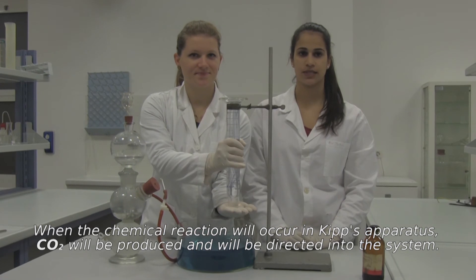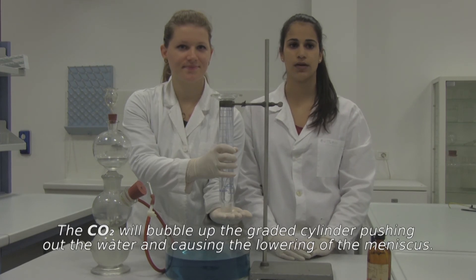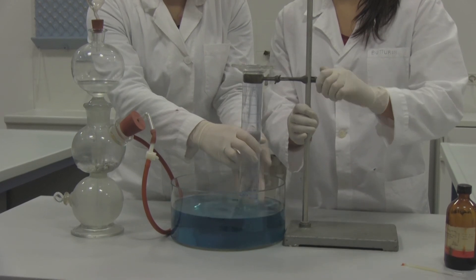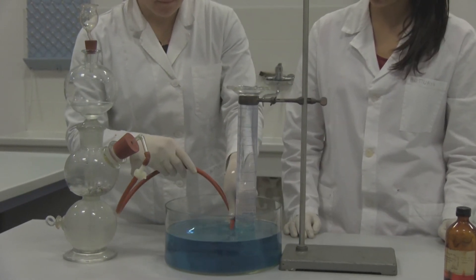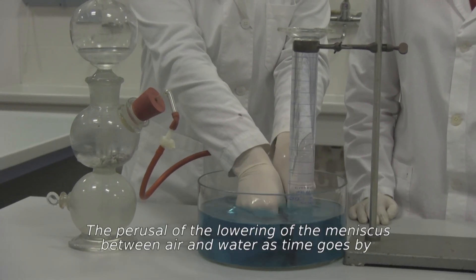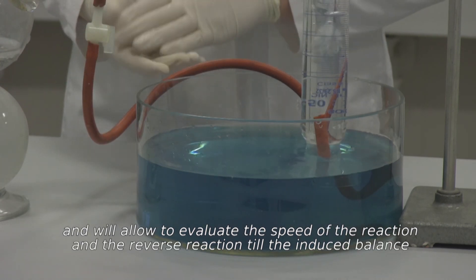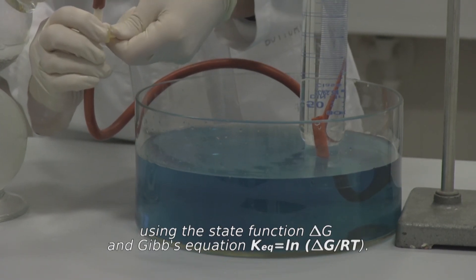When the chemical reaction will occur in Kipp's apparatus, CO₂ will be produced and will be directed into the system. The CO₂ will bubble up the graduated cylinder, pushing out the water and causing the lowering of the meniscus. The measurement of the lowering of the meniscus between air and water as time goes by will allow to assess the variation of the produced volume of carbon dioxide over delta time, and will allow to evaluate the speed of the reaction reactants to products and the reverse reaction till the induced balance, using the state function delta G and the Gibbs equation.